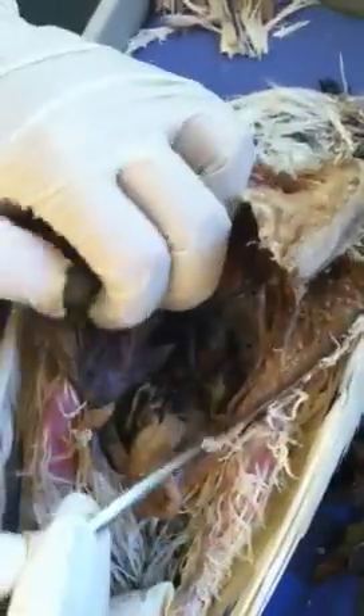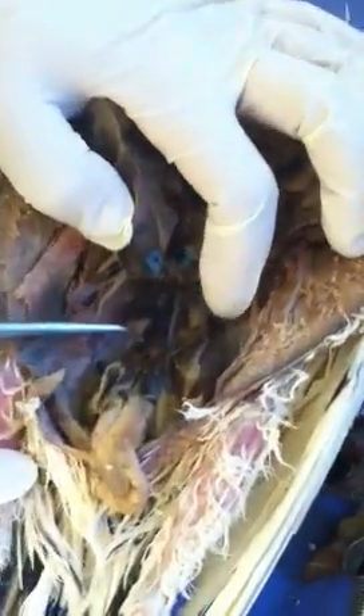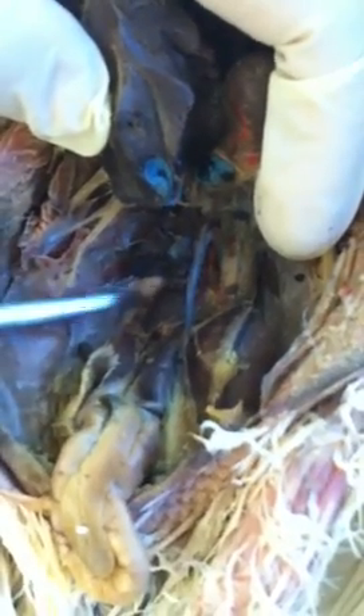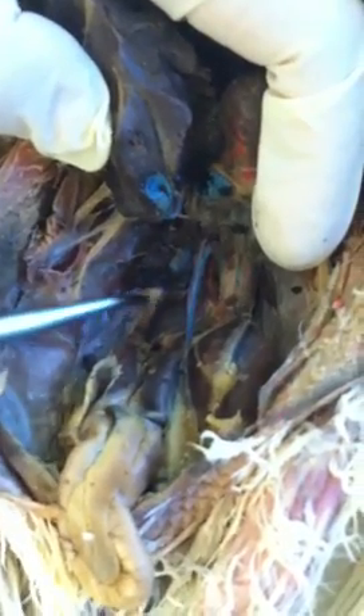After the pancreas you will see the intestine, just like regular intestine. If I remove all the organs on top, you will see an organ beneath, attached to the backbone — that's the kidney. Right next to the kidney you will see something whitish; that's the testes, but just know the organ attached to the backbone right by that whitish thing is the kidney.